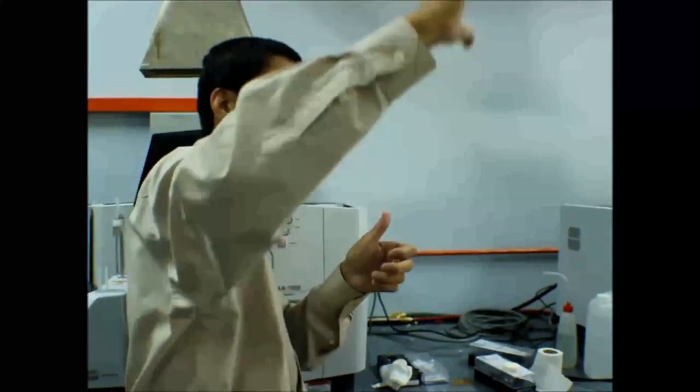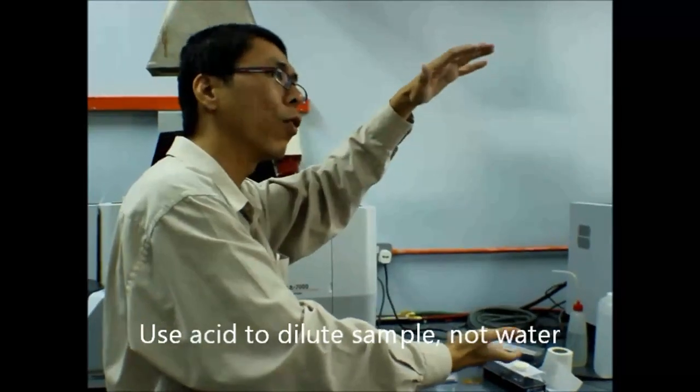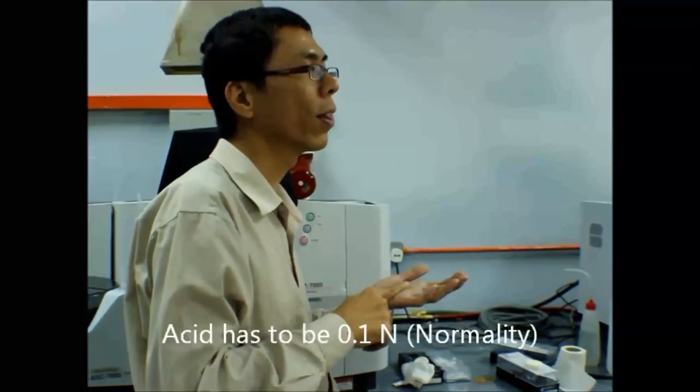Your water. So you do dilution, you use acid to do dilution. Don't use water. So you prepare maybe 1 or 2 liter of 0.1 normality acid. So how to convert that one? I'll teach you how to convert. Because normally they give you some percentage, not in molarity or normality. I want 0.1 normality.